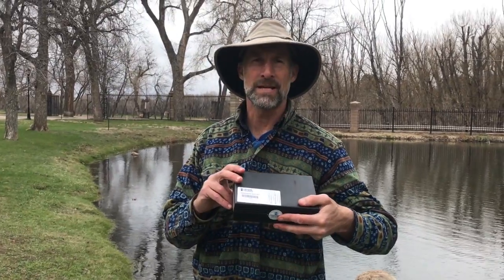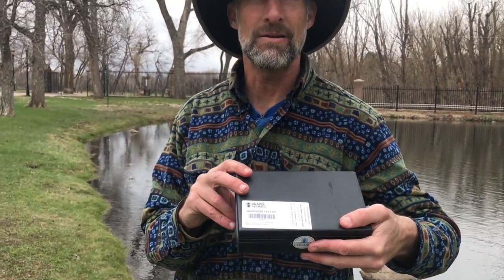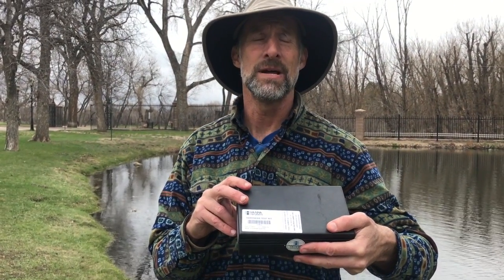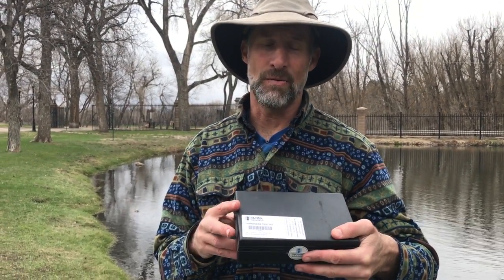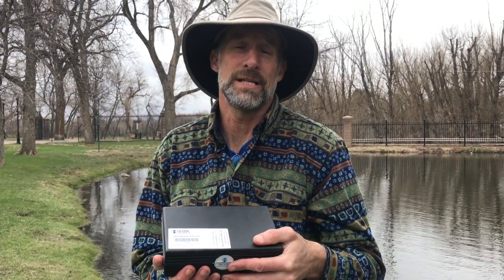All right, we're now going to look at hardness, water hardness. Hardness is very similar to alkalinity. Alkalinity measures calcium carbonate. Hardness measures calcium ions and magnesium ions. And this is what makes your water in your house either hard or soft when you take showers. Some places you add water softener to your water if you have high water hardness.